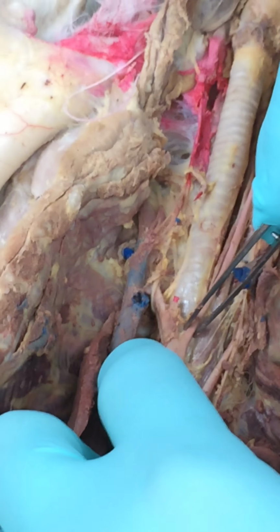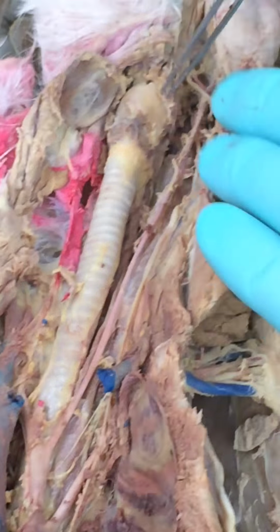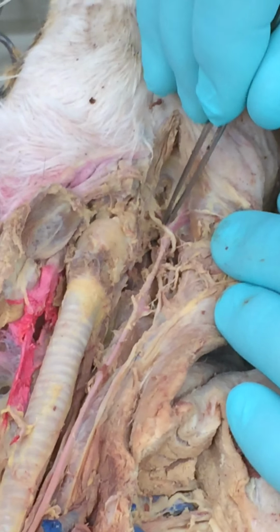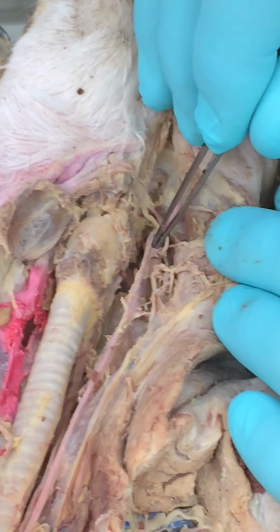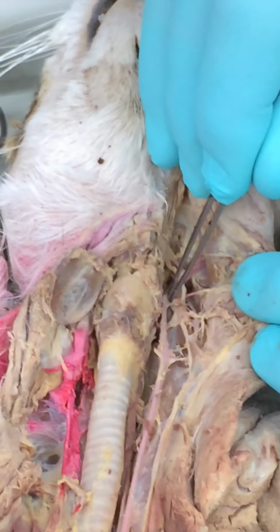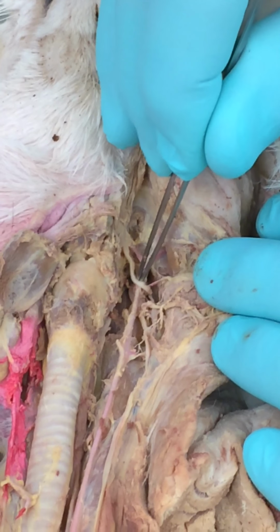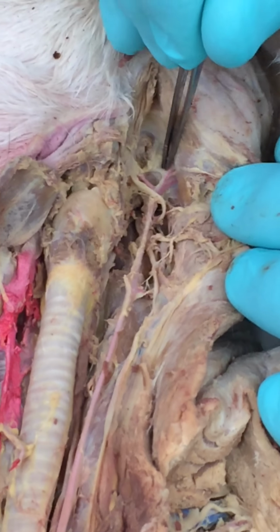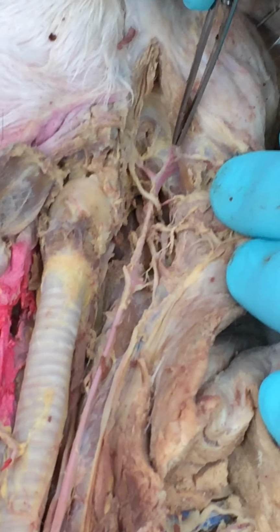Brachiocephalic artery bifurcates again as the left common carotid that runs the whole way up here, and then it branches again. So you look for where this vagus nerve comes down, and right there you can see there's a little branch. I'm kind of under it right here. That's the internal carotid. Everything up from that is then external carotid. So all that's external. Everything in here, that's internal carotid. And this one right here, it's kind of obvious, that's the lingual. It runs over to the tongue.